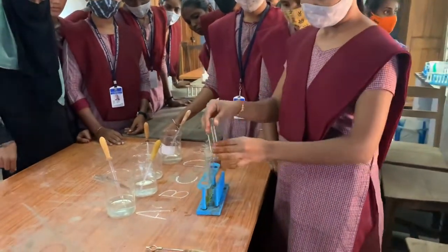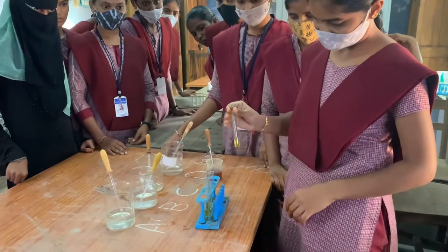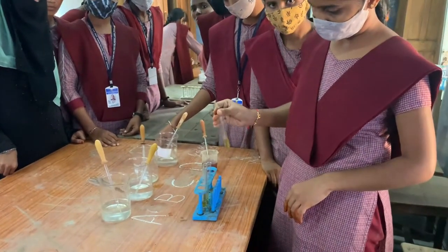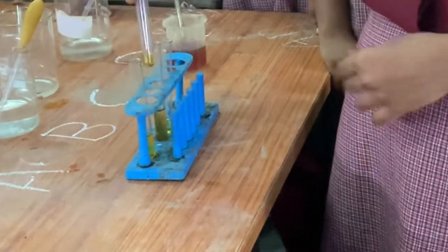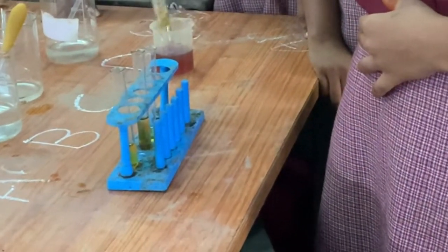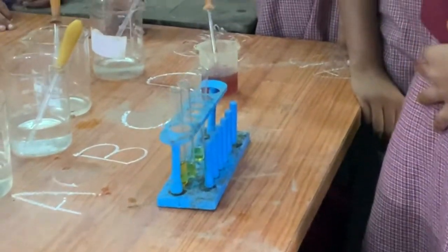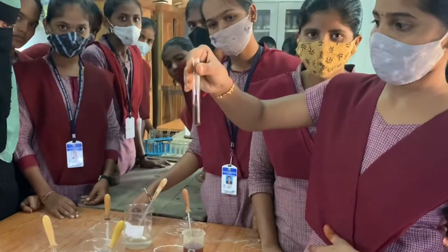Then we have to observe the four test tubes. In test tube A, the solution doesn't change its colour. Test tube B also shows no colour change. Next, test tube C — the sample turns to blue colour.